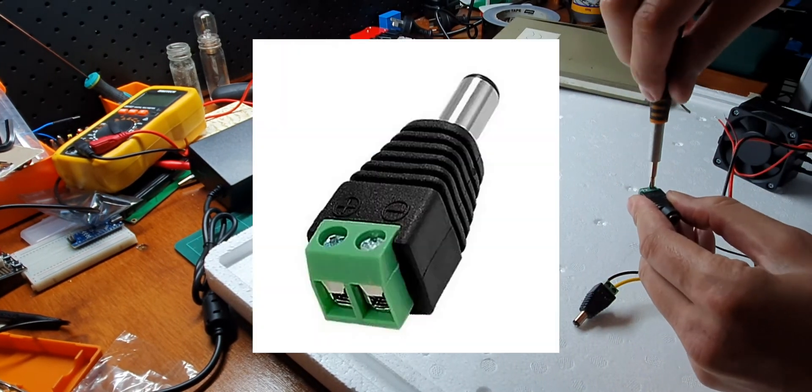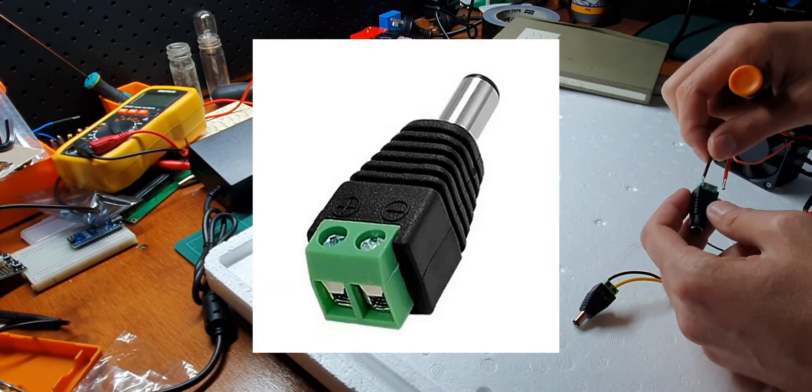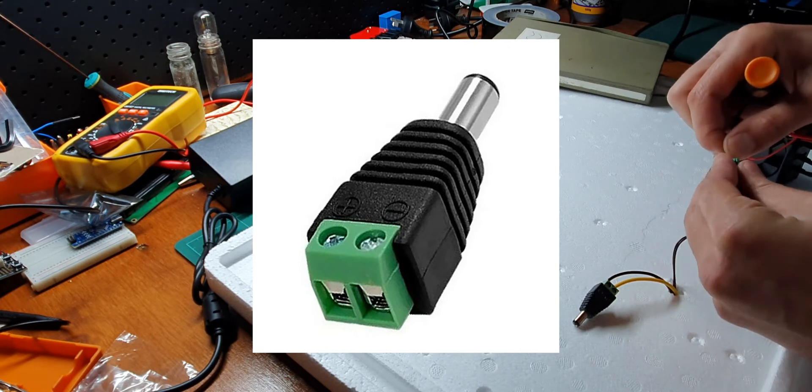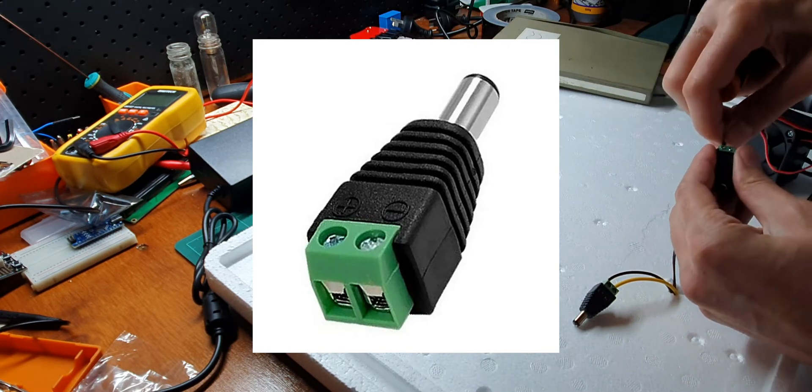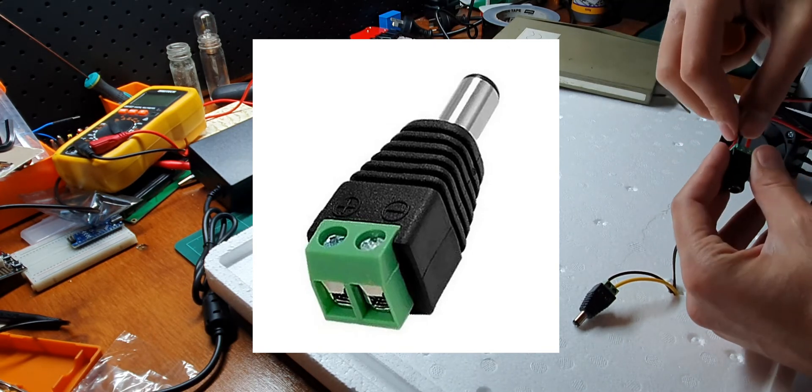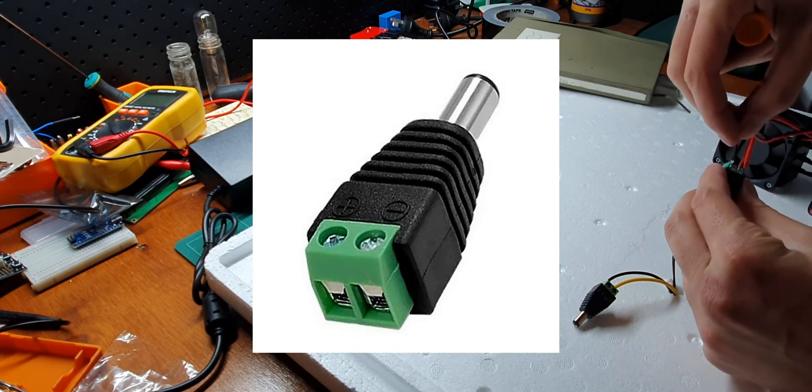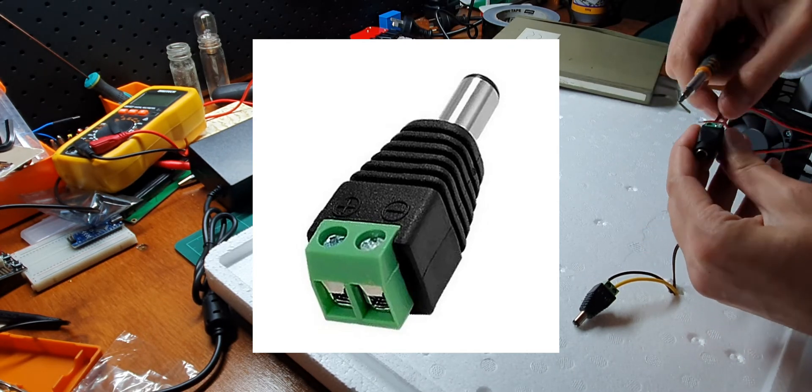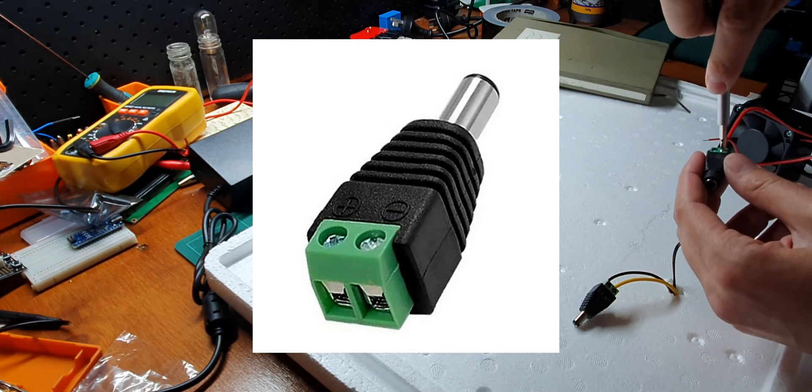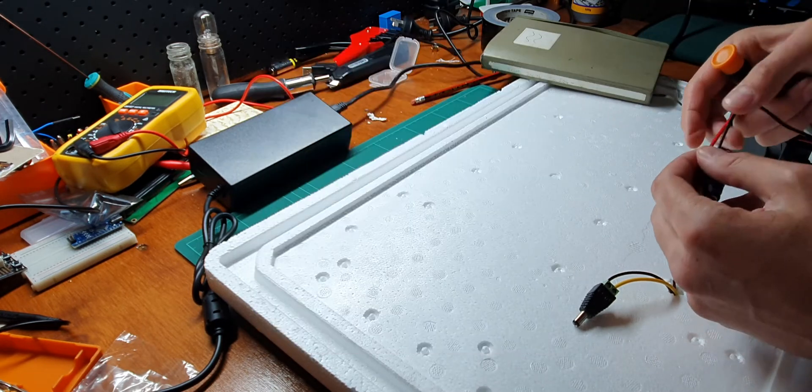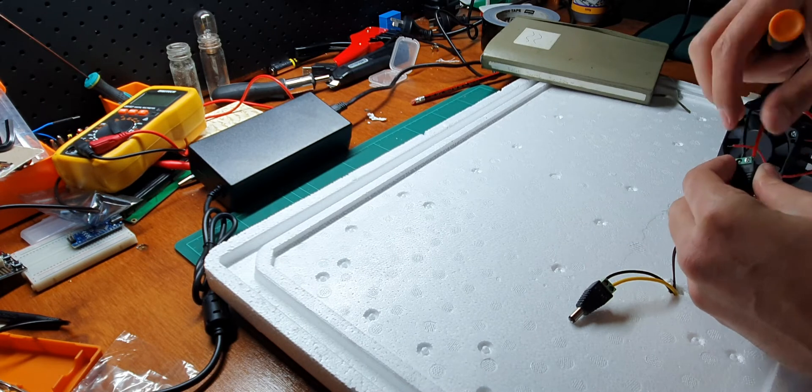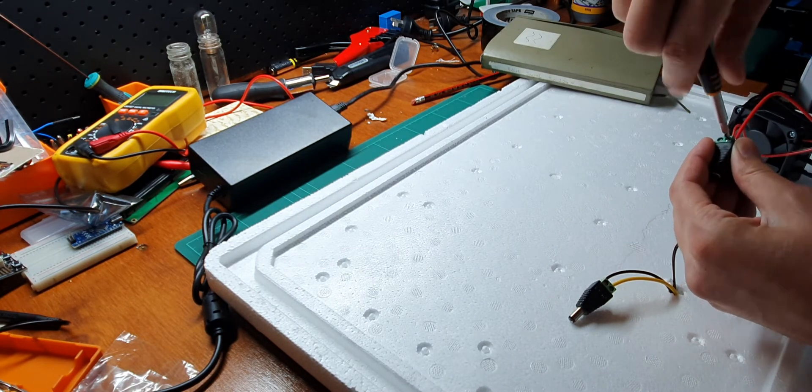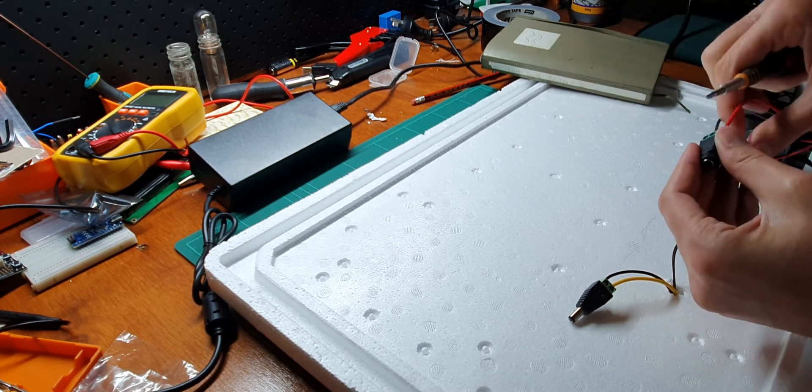And for those of you that have never worked with electronics before, wires, anything like that, just be sure to connect your colored wire to the positive symbols that might be red or yellow and your black wire to the negative symbol. You also notice that the fan, I'm actually putting both black wires in one of the negative areas and both red wires in one of the positive areas.